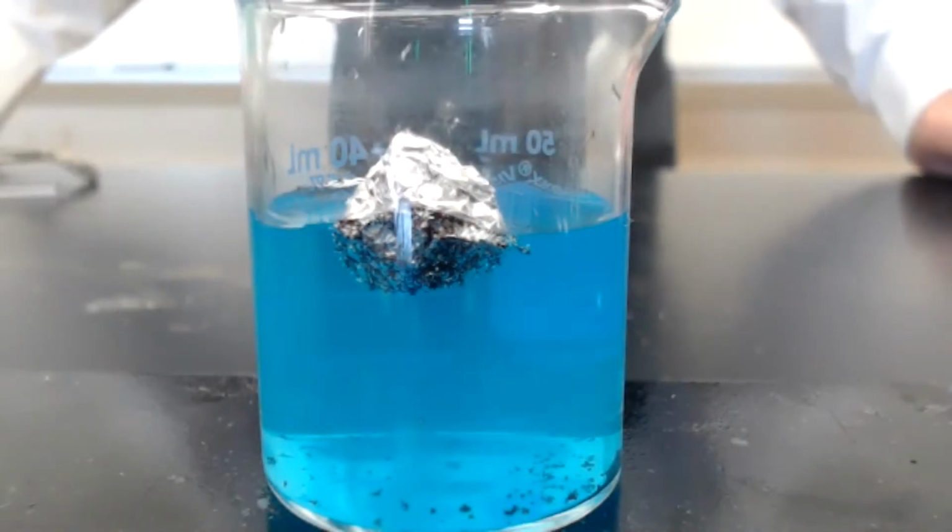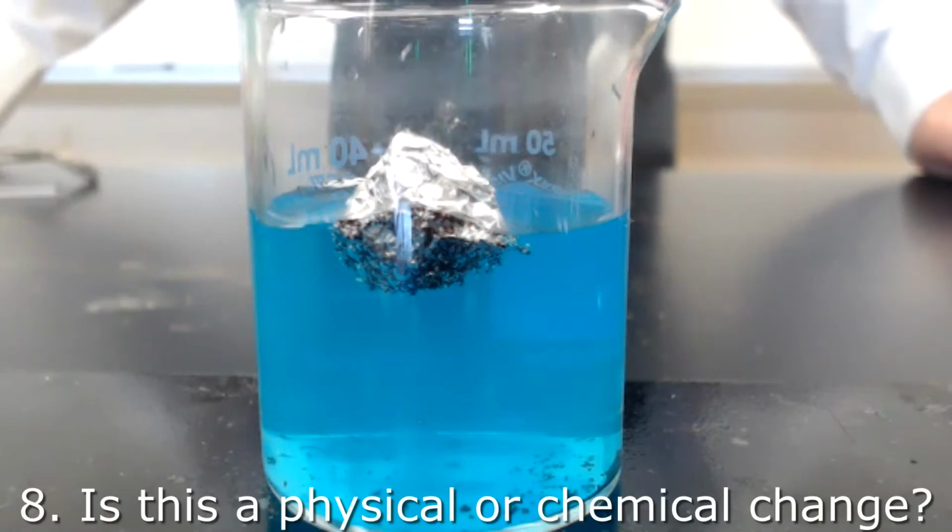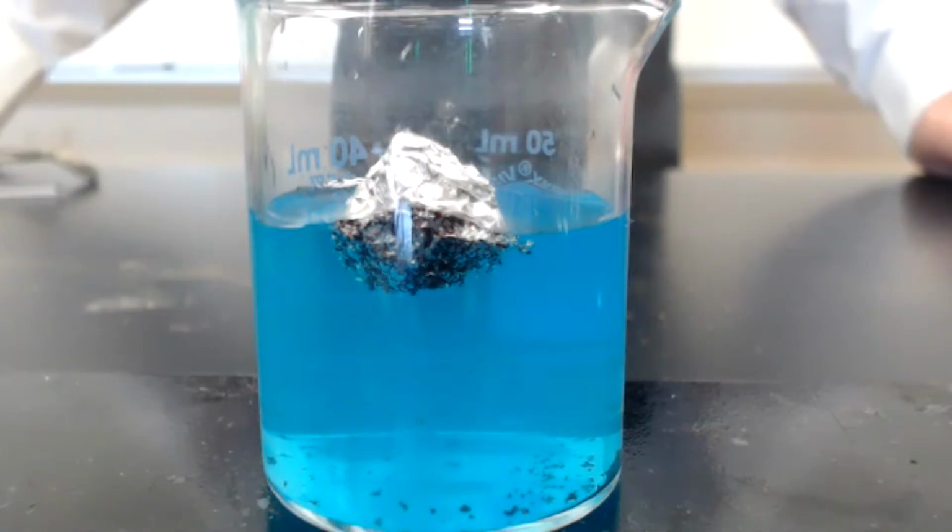Is this a chemical or a physical change? What do we think those brown flakes that formed are?